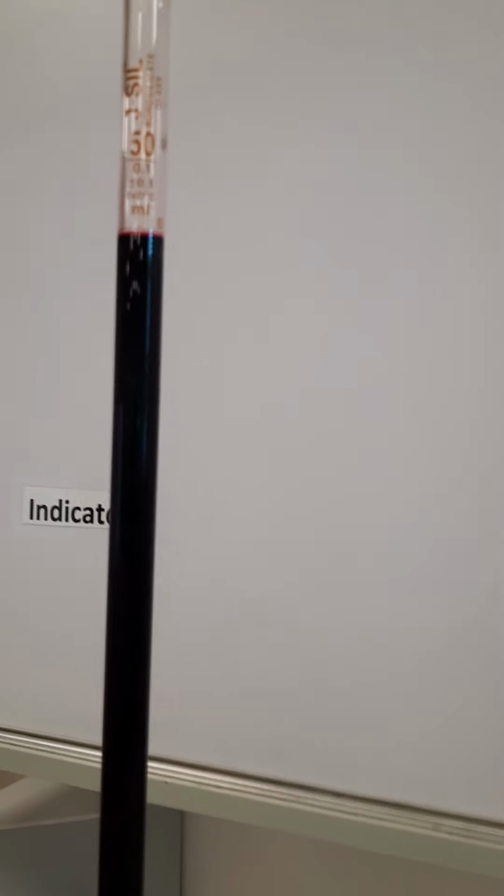We prepared the burette and filled until 0. Now this solution is a very dense color, so it is difficult to take the volume at the bottom of the curve. So you can here read the top of the curve or tip of the meniscus. That will be okay. So we filled until 50.